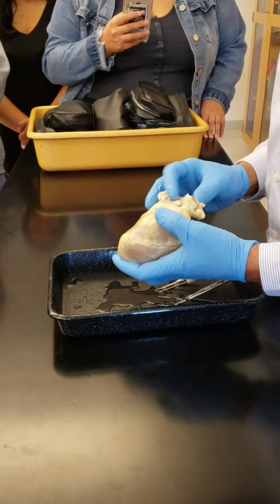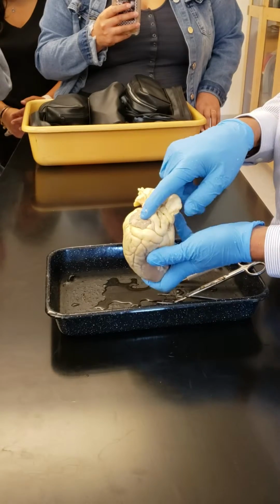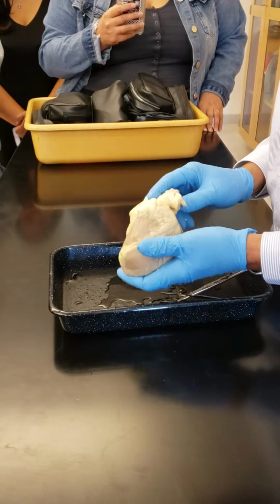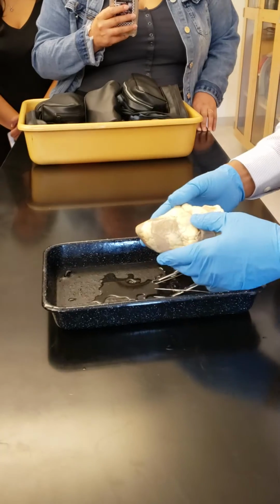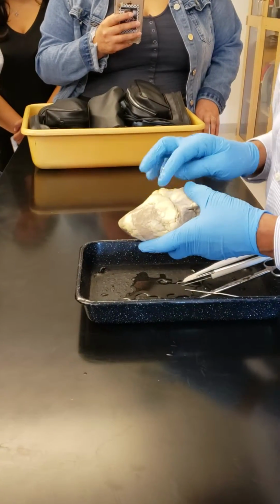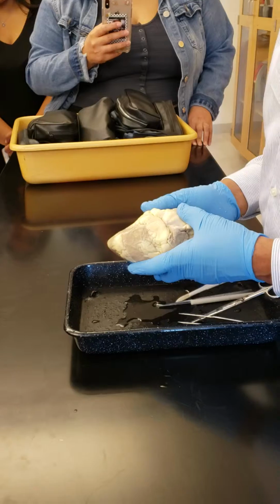So here, the structures are, first of all, this is an atrium, and this is atrium, right? And these big ones are the ventricles. Now, which is left and which is right? To identify that in this shape, what you have to do is turn it around and look at this groove. The groove that goes oblique is in the front.